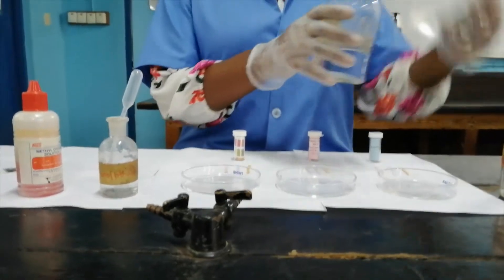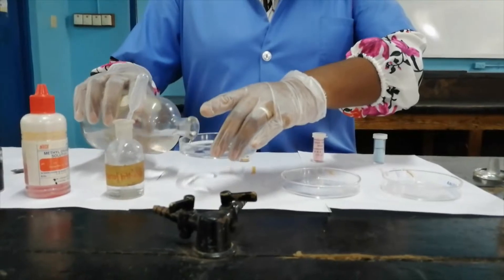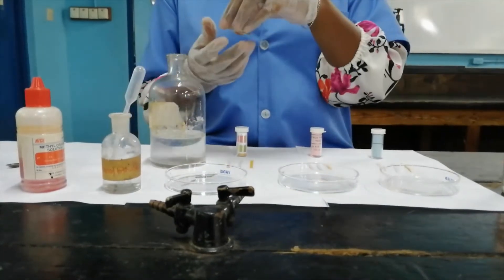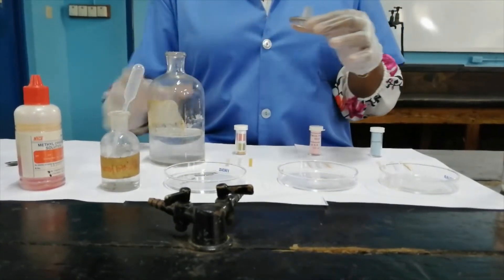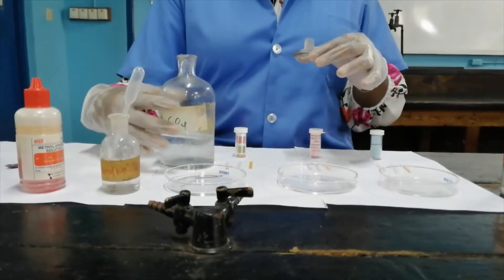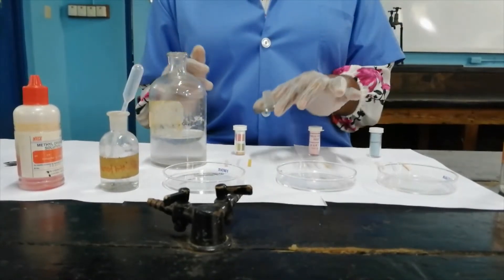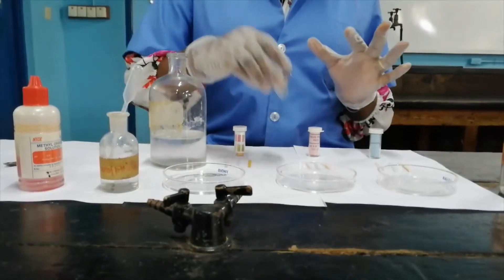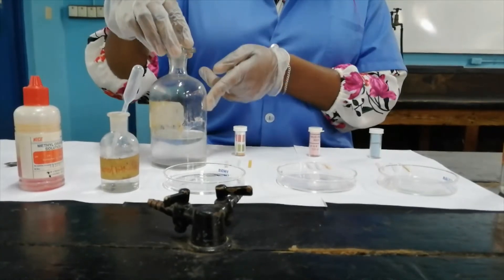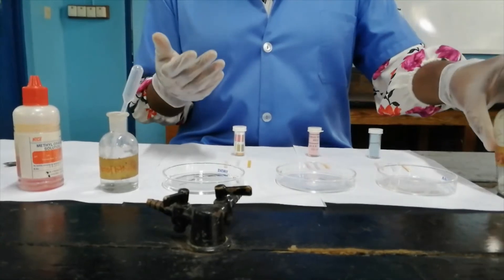I'm going to use sulfuric acid and pour it into this special dish. Notice how I use the reagent bottle — when you're pouring, you don't pour from the label side; you cover the label, because if acid runs down you don't want it damaging the label so you still know what's in the bottle. The reagent stopper you place face-down like this — you do not place it the other way because dirt particles could contaminate the stopper and fall into the solution.